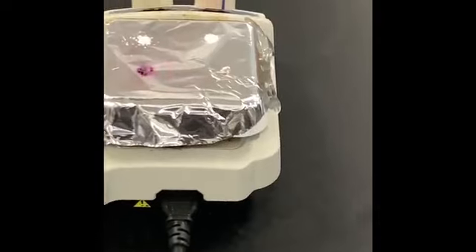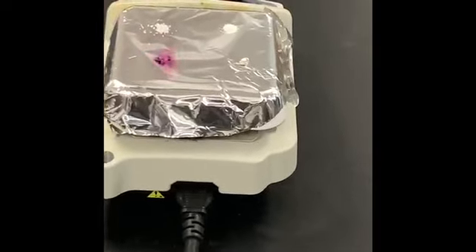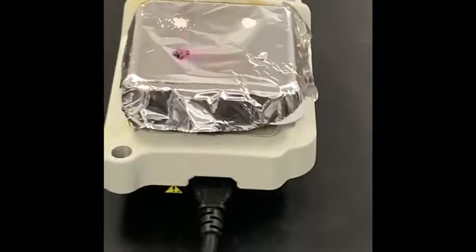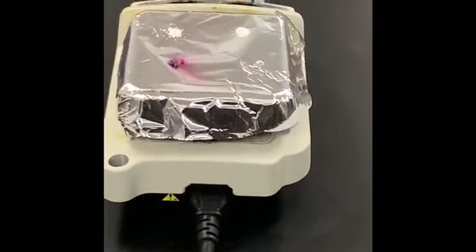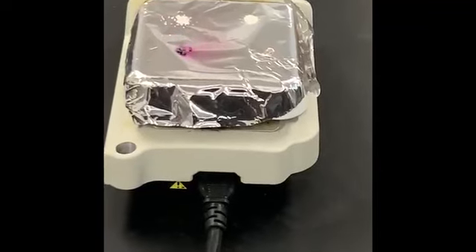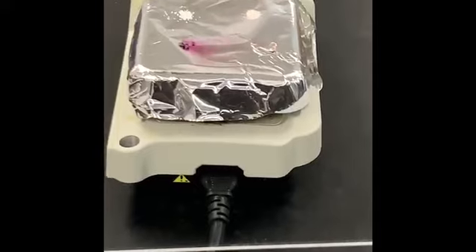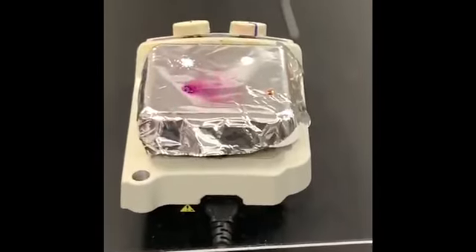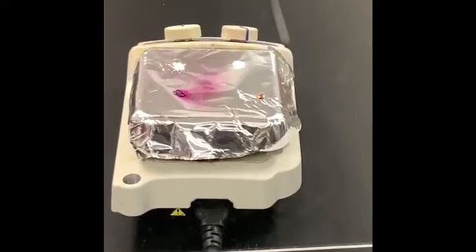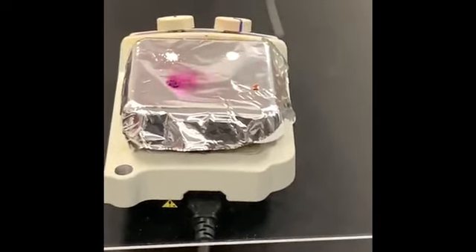The one that has melted, indicated as the first to have melted. That means it was not melting, okay? It was subliming. So it is basically subliming.